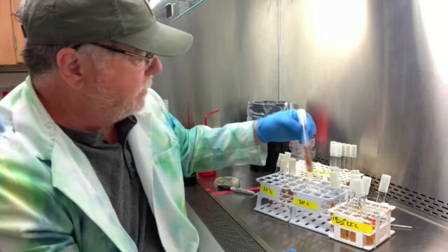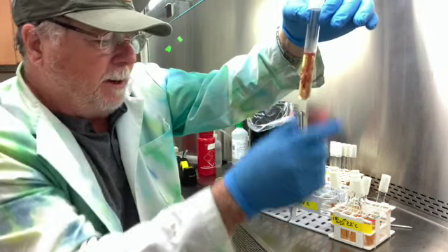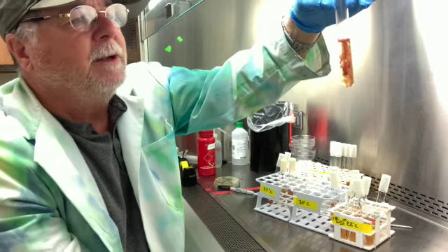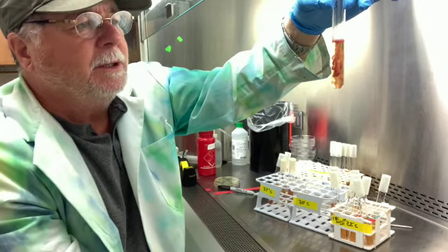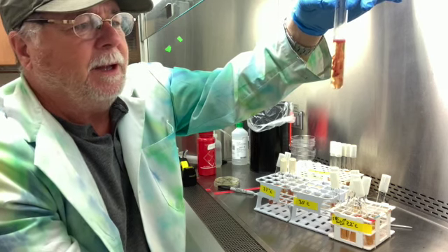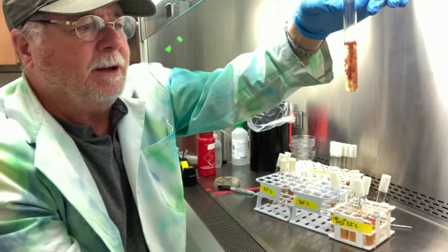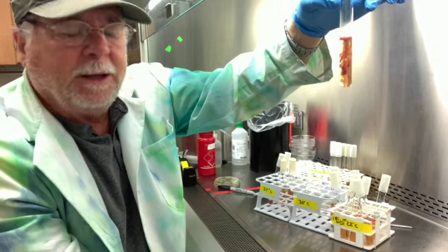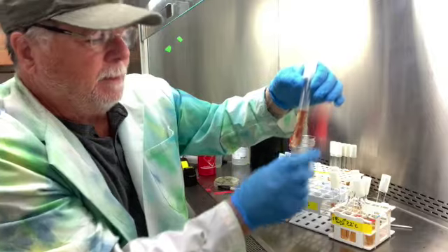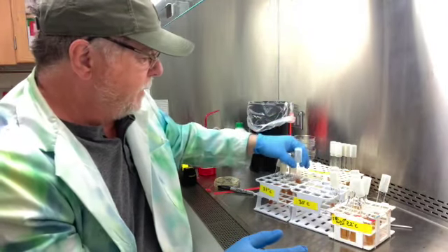Number five, also great growth. This is number five, and so it's Enterobacter aerogenes. And number five is showing growth throughout, a little bit better on the top, but it grows really well down deep, and it is expanding out from the central pierce line. So this is a facultative anaerobe, and it is also motile. So this is number five, Enterobacter aerogenes.